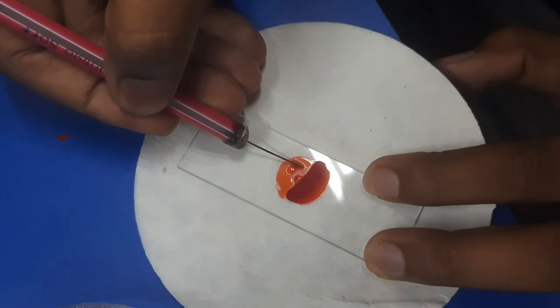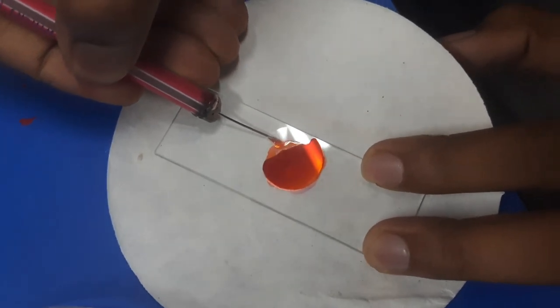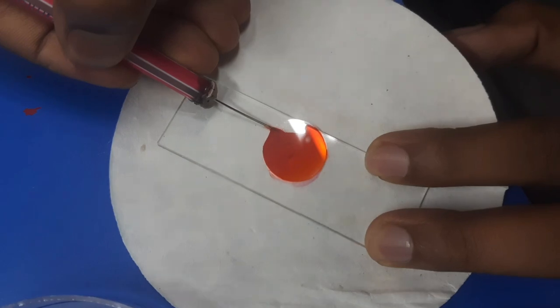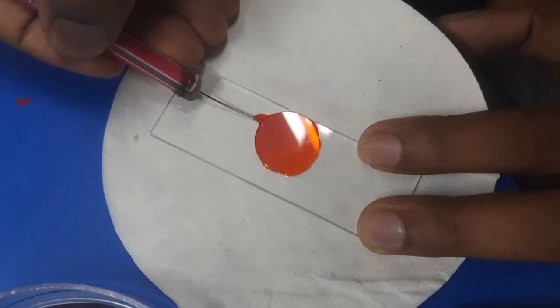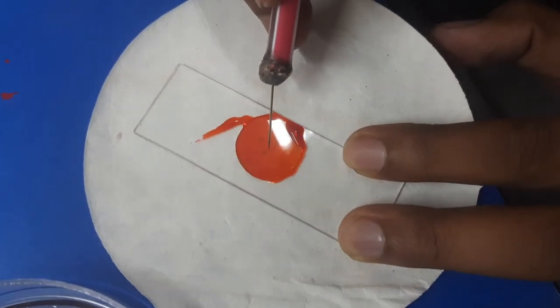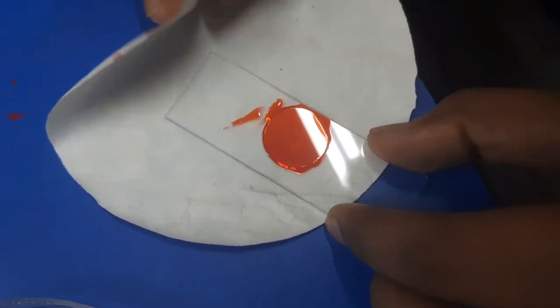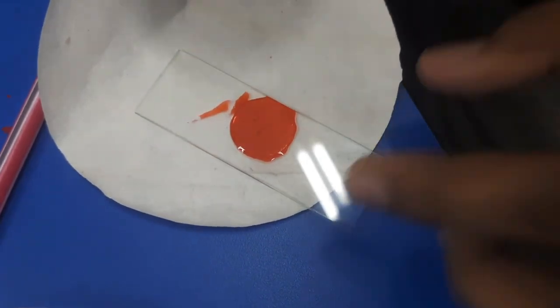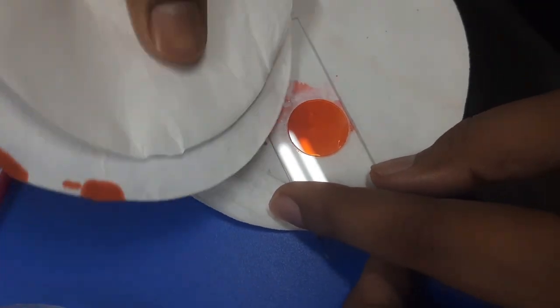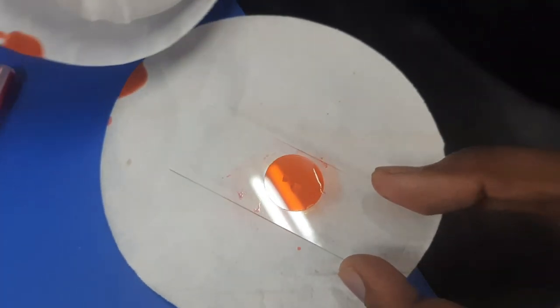But when placing the coverslip, due to capillary action the stain should not form bubbles. After that during mounting, the excess stain that comes out, we will soak it using filter paper and press it a little so that the excess stain comes out from the sides. We can easily soak it with filter paper.